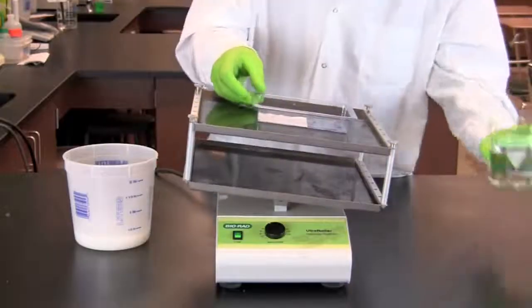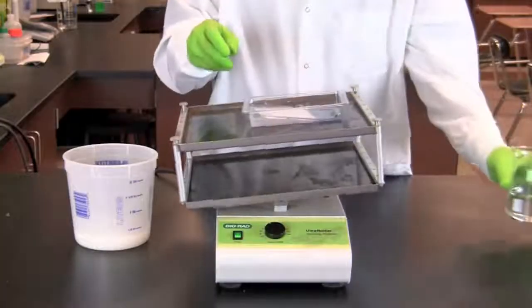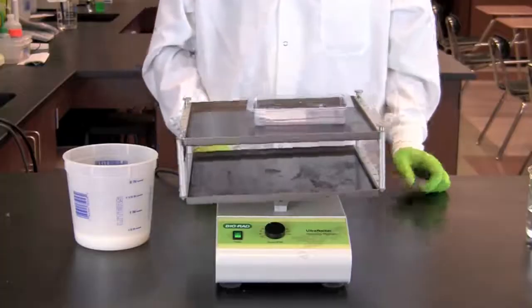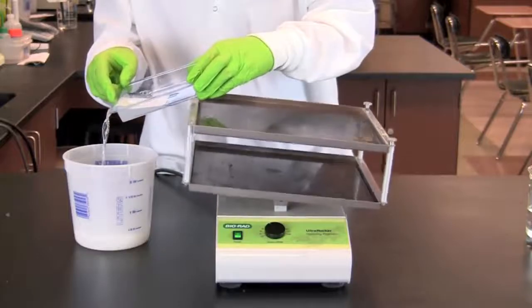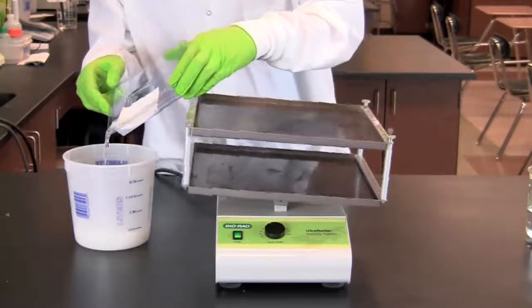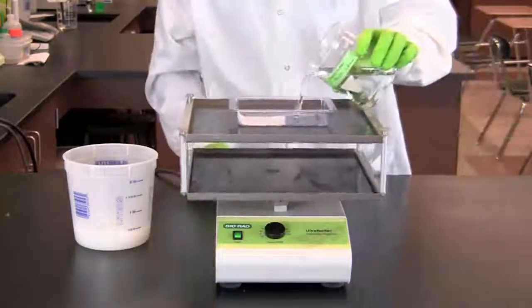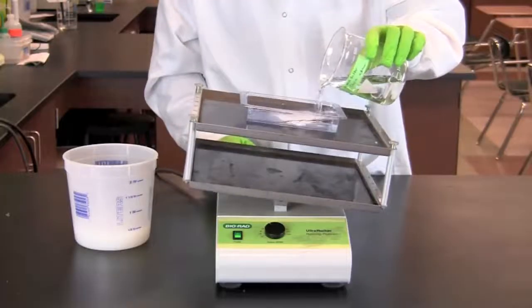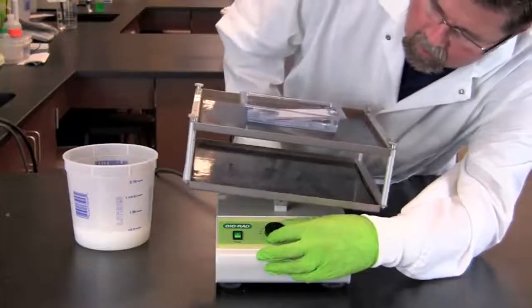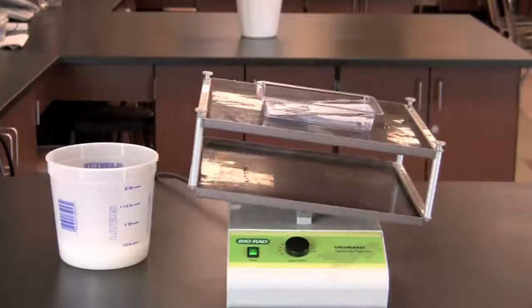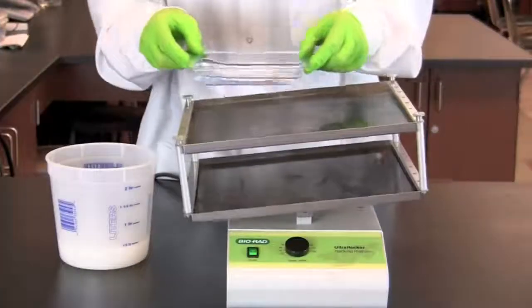Rinse the membrane quickly in 50 milliliters of wash buffer and discard the wash buffer. Add an additional 50 milliliters of wash buffer and wash the membrane for three minutes on the rocking platform on a medium speed setting. Discard the wash buffer.